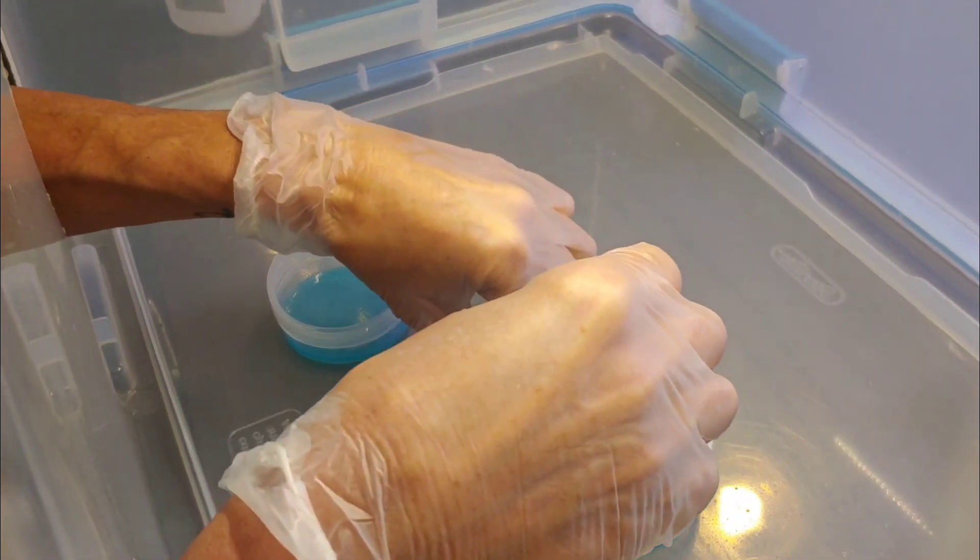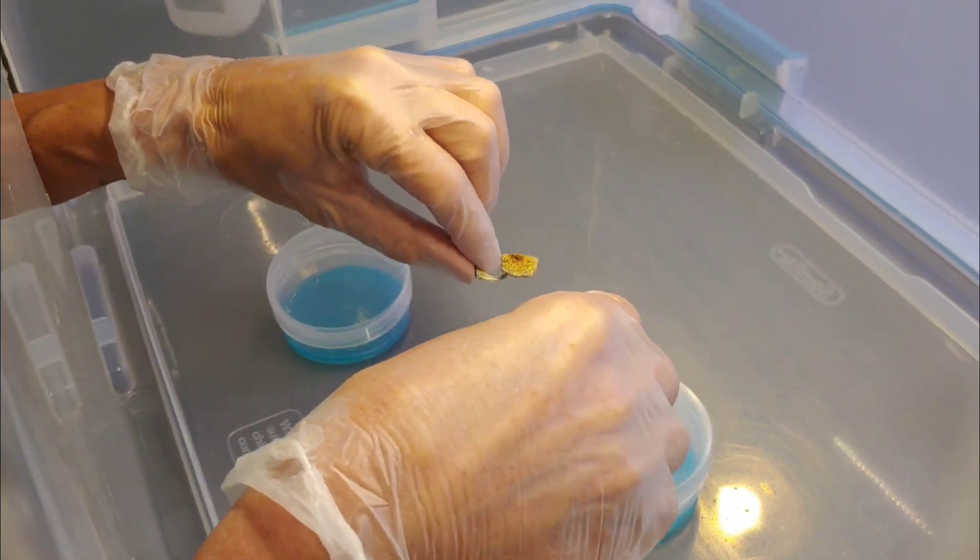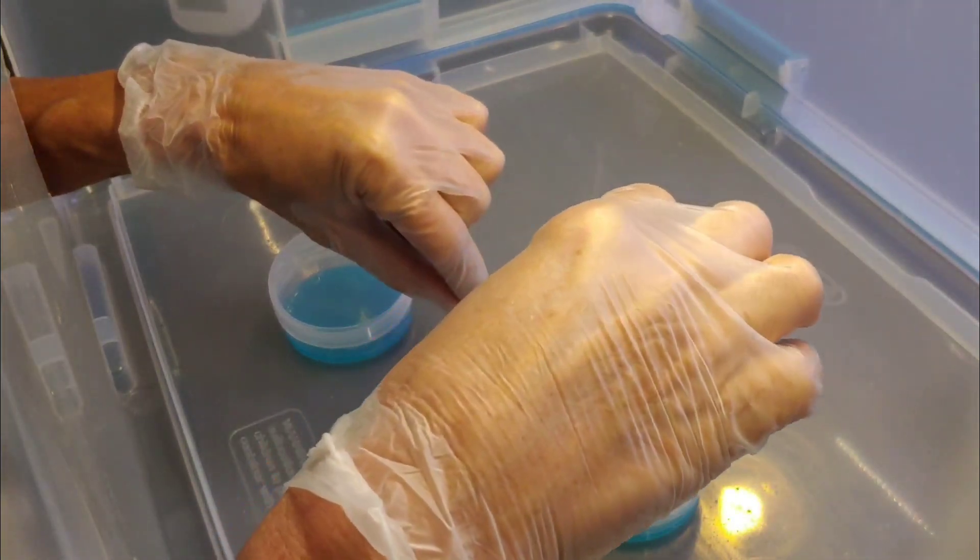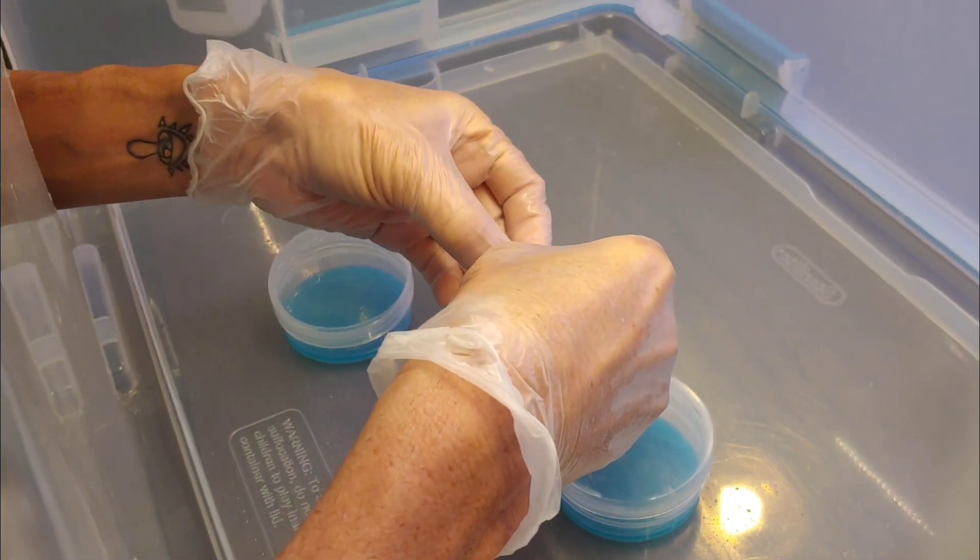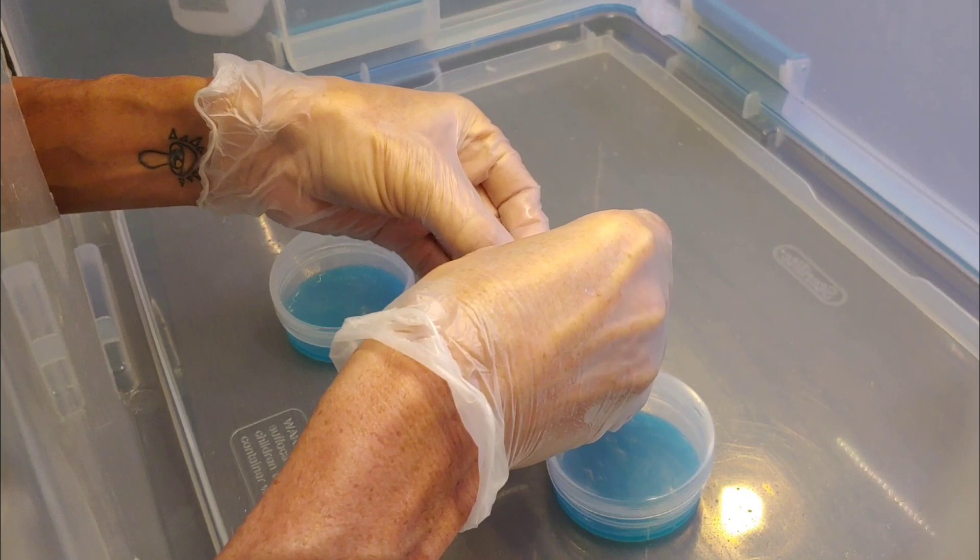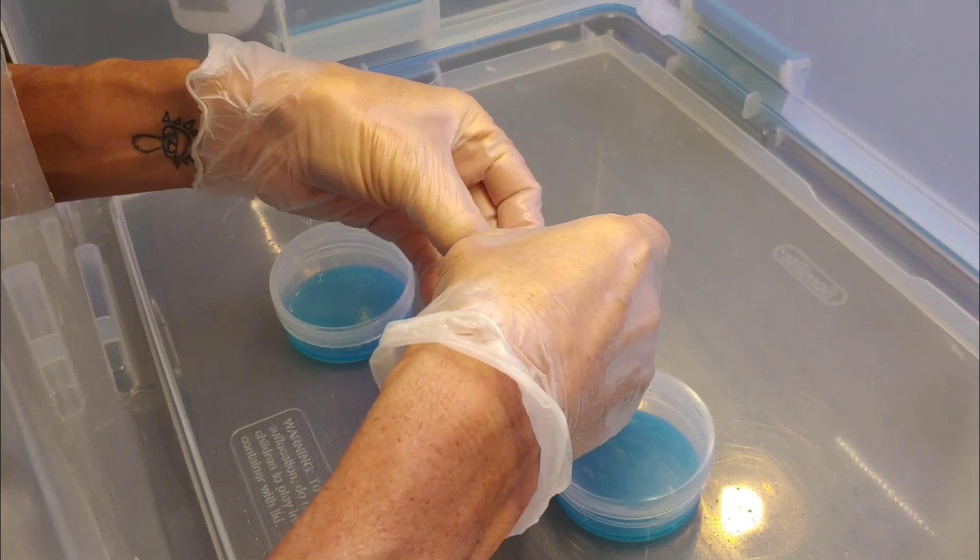So here we go, I am going to take, I have heard that you should put it with the spores down. So, I am going to take a small piece and just clip it with my fingers.